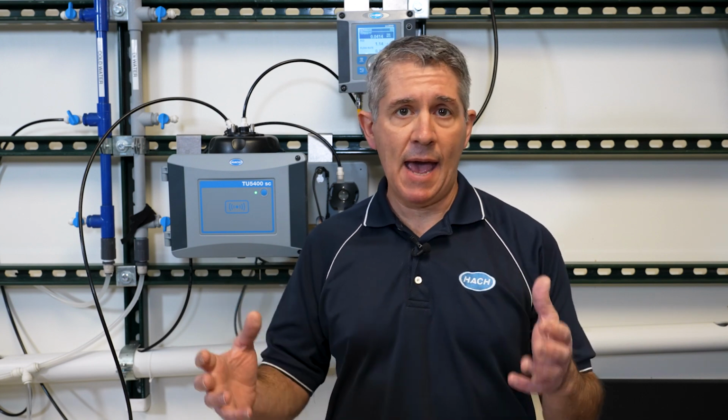Those of you that are familiar with this know that there is somewhere along the way you have to do some form of a pressure decay test that uses gas, it uses air, and then it introduces air into the sample line, and that can cause problems inside of the turbidimeter. So the turbidimeter is working fine, it's working the way it should.